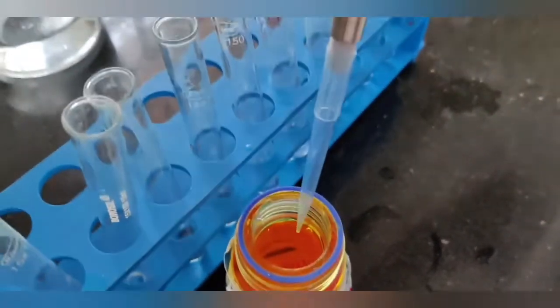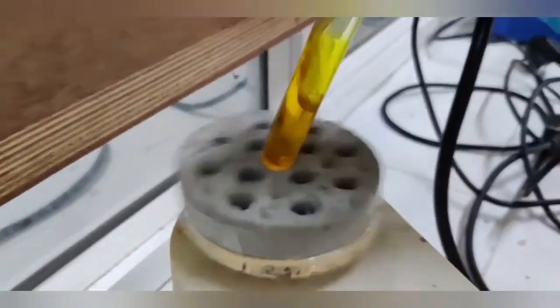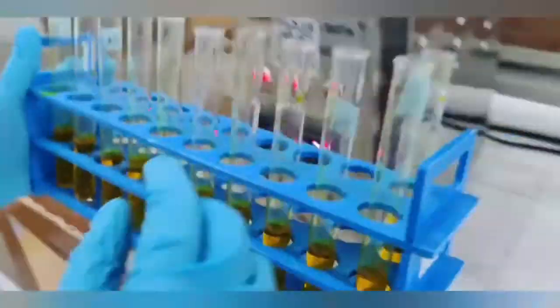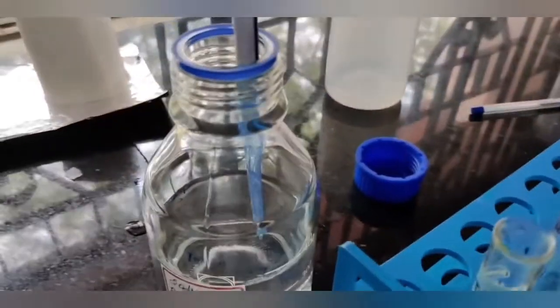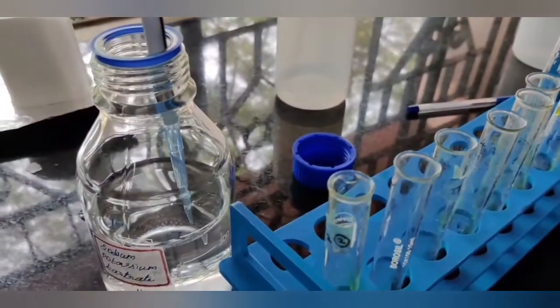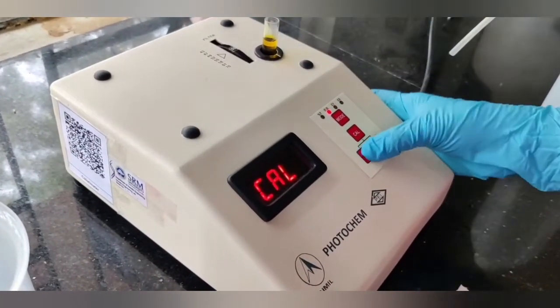Then make up all the tubes to 3 ml with distilled water, from blank to test tubes. Now add 3 ml of DNS reagent to all the tubes and leave for incubation at 90 degrees centigrade for 10 to 15 minutes. After cooling the tubes, add 1 ml of 40% sodium potassium tartarate and measure the absorbance at 540 nanometers.